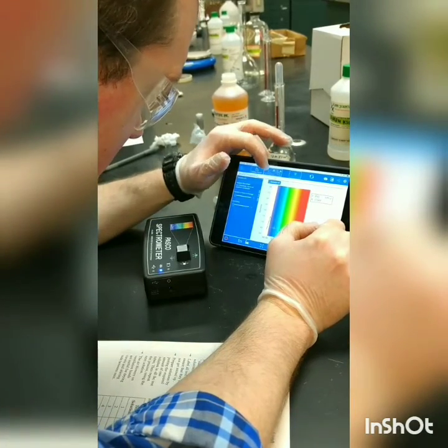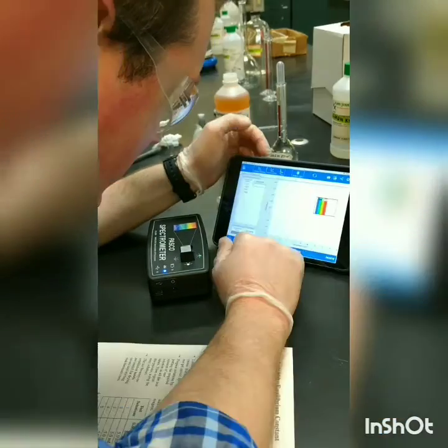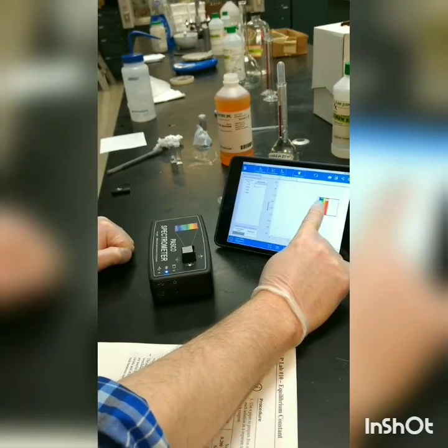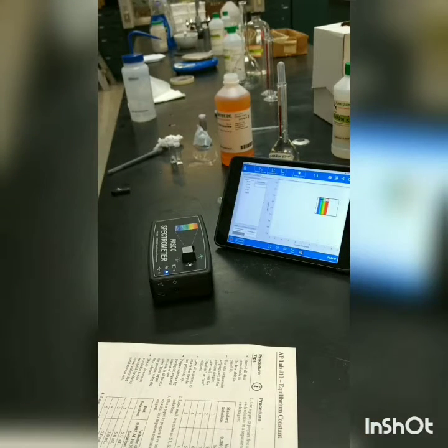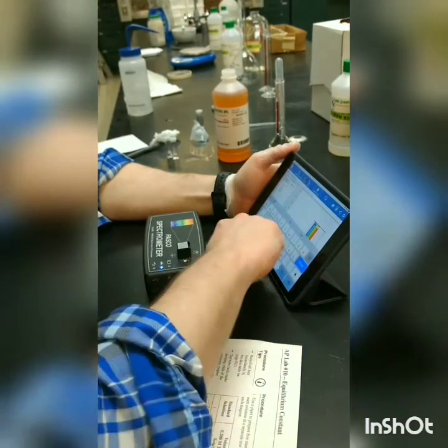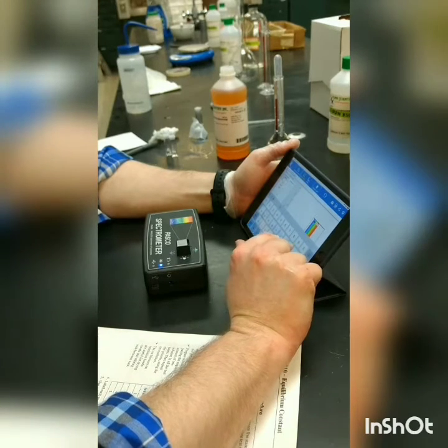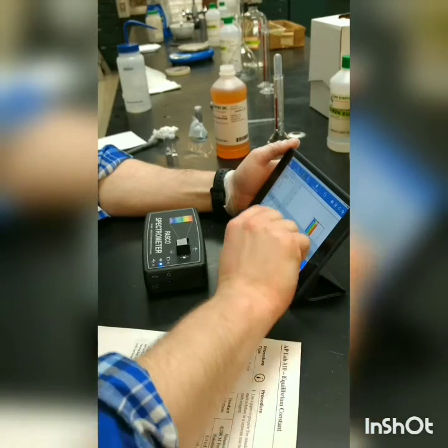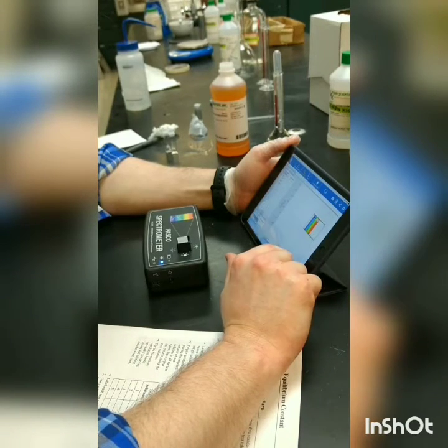Okay, and then we're going to go to our concentration. All right, so now we're on the point where we're going to do Beer's law here. So it's telling us right here that we're using the 450 nanometer wavelength. Okay, and we're going to tell it the first concentration. And again, we'll go over how to calculate the initial concentration, because that is a calculation that you will have to do to complete the packet. But the initial concentration for this first sample is 0.00004. Okay, so we're going to enter that there.